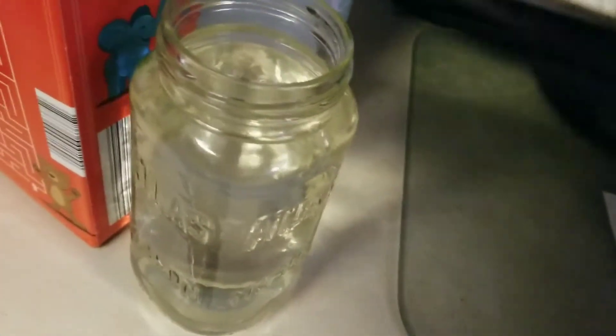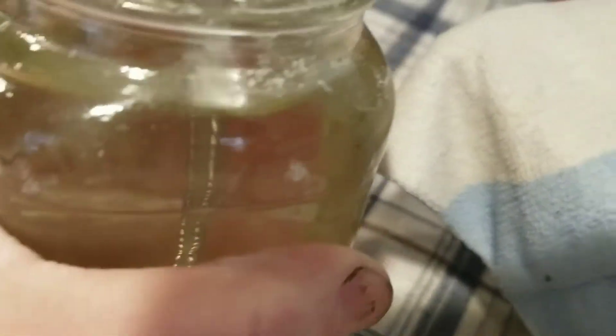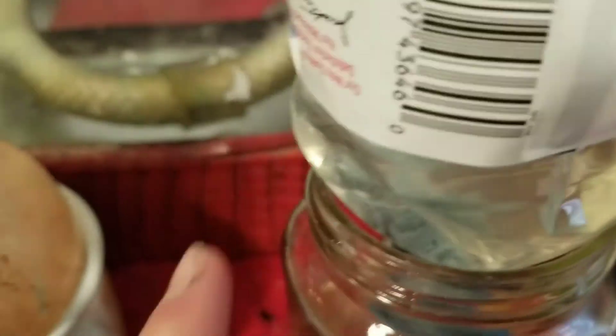I'm going to heat up some water to dissolve the washing soda. The water is very hot — it's from my coffee maker, so it's about coffee temperature. I'm going to add this hot powder to the water. The water is probably a bit brown since it's from my coffee maker, but it will be purer after filtering. I decided to filter it once with a weak filter — it's still got a weird color, but it's going to be pure enough and I don't think it's going to affect the calcite crystals significantly.